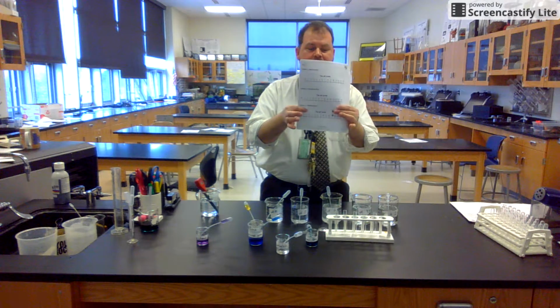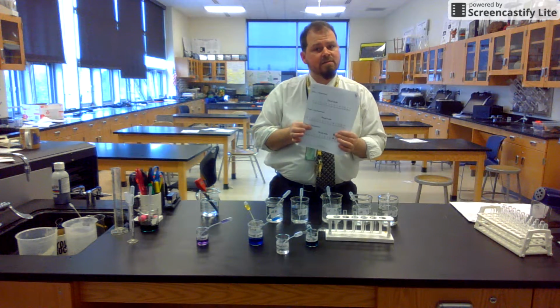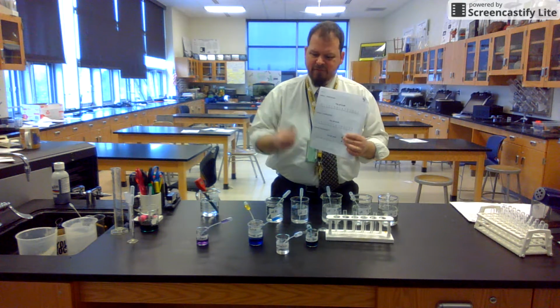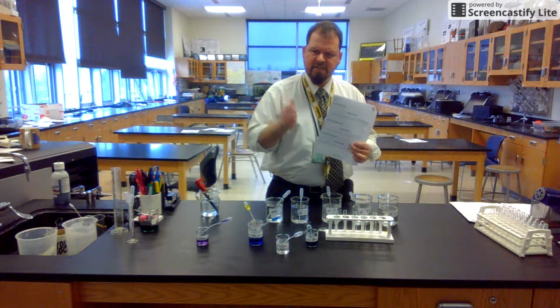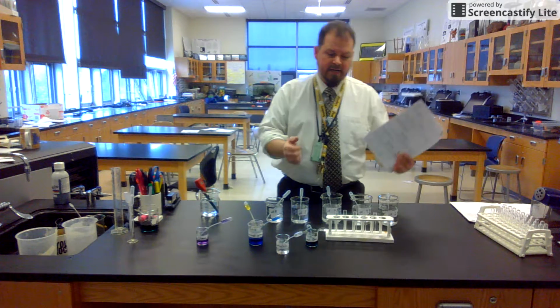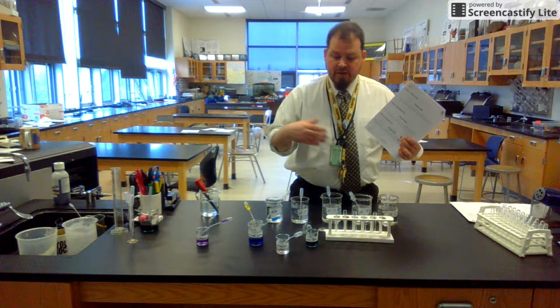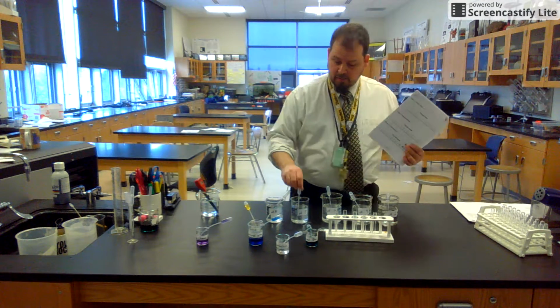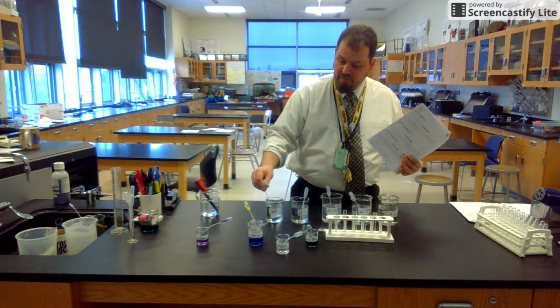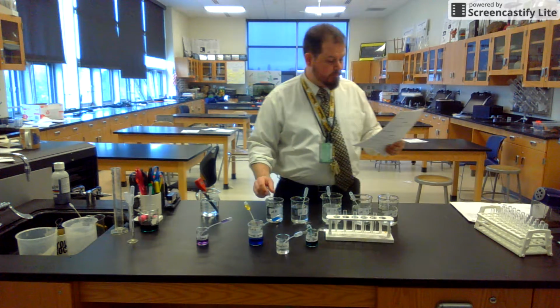I'm probably not going to let you do the lab unless I see the note. We're going to do phenolphthalein last because then I will wash your test tubes. They'll stay in the sink. We'll wash them up. And phenolphthalein tends to stick to the glass. So it really does need to be washed with a chemical to get it out of there. If you use phenolphthalein beforehand and then you put a base, pH 10, in there, it's going to turn colors before you even put an indicator in because it's going to kind of stick to the glass, okay?